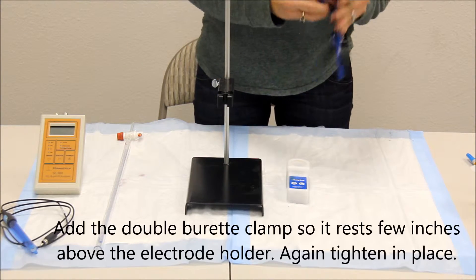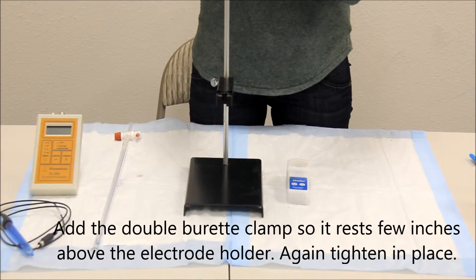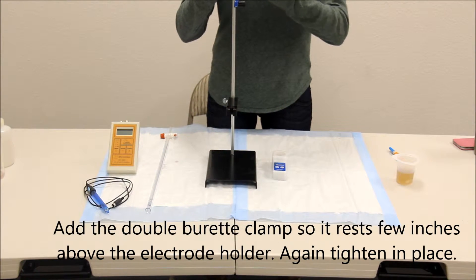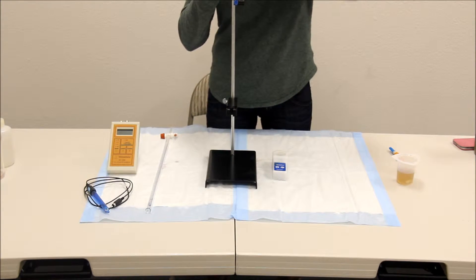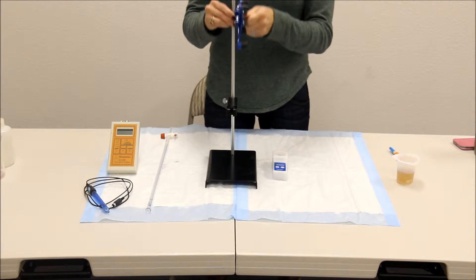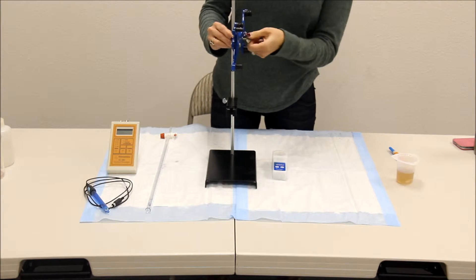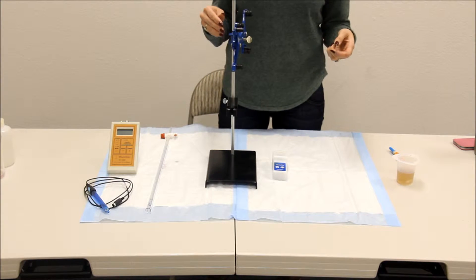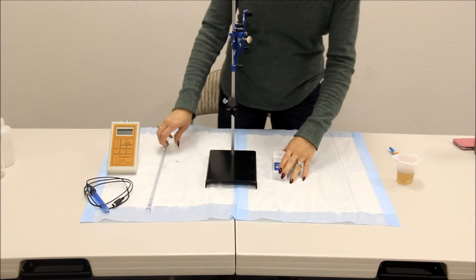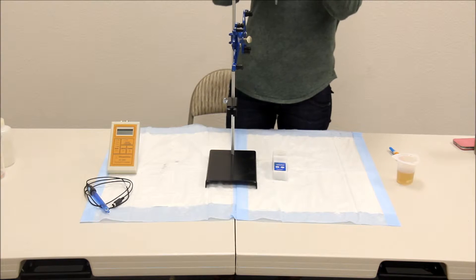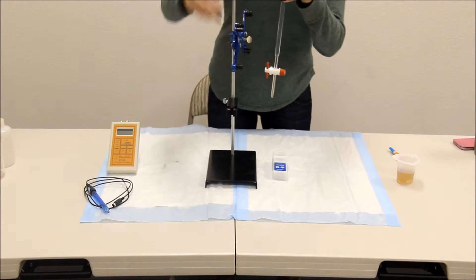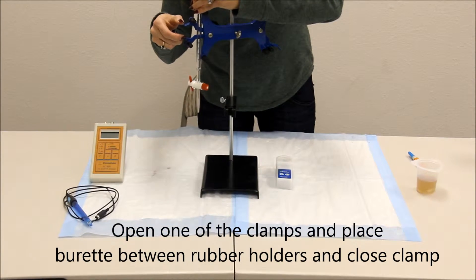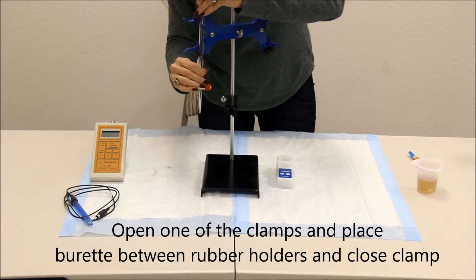You can now add your double burette clamp. Slide in your burette.